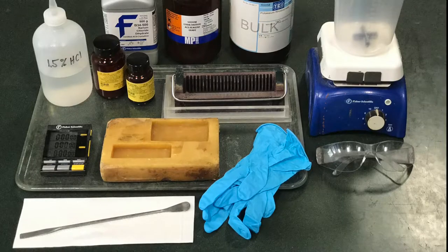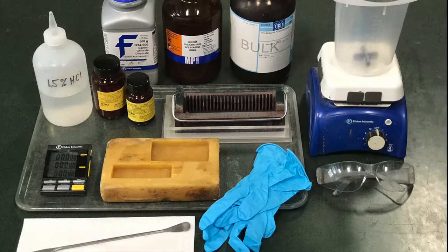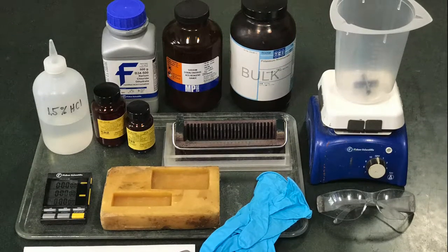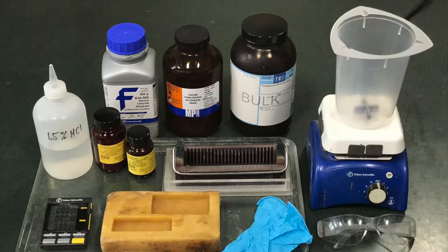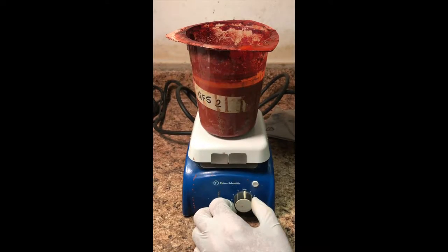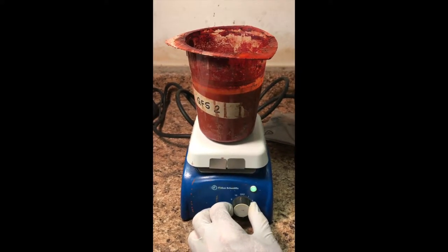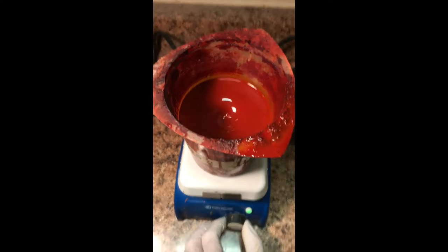The staining procedure is straightforward and similar for all types of stains. Protective equipment and caution are essential, as some of the chemical components are very dangerous. The first step is to calibrate and mix a chemical solution or reagent that will react with the desired mineral.